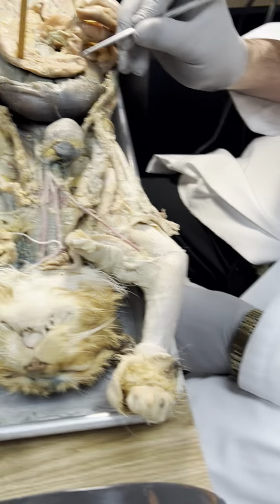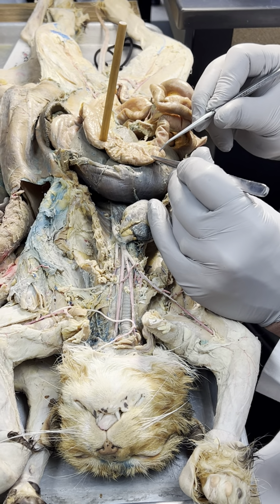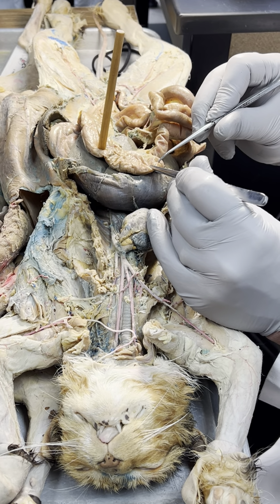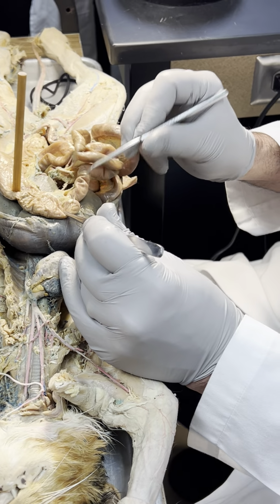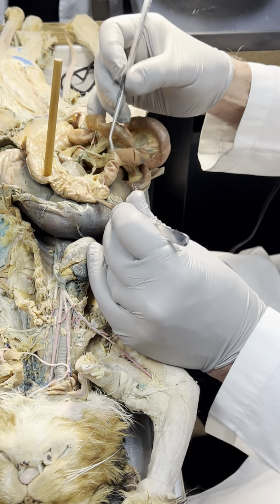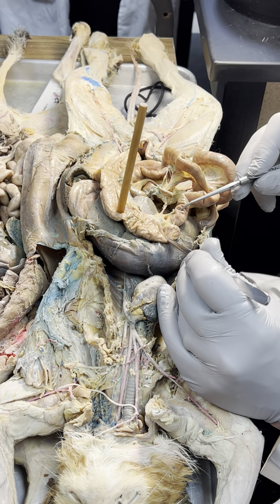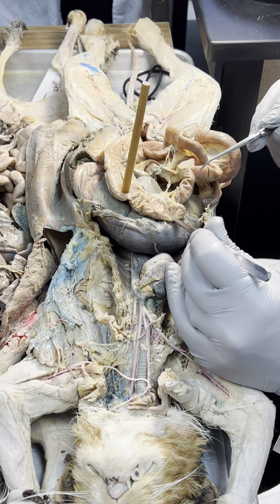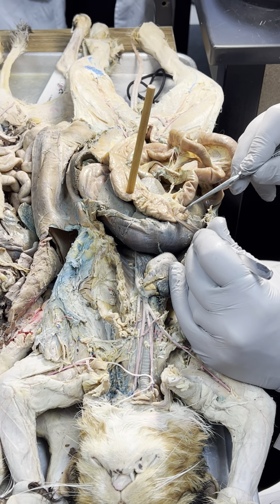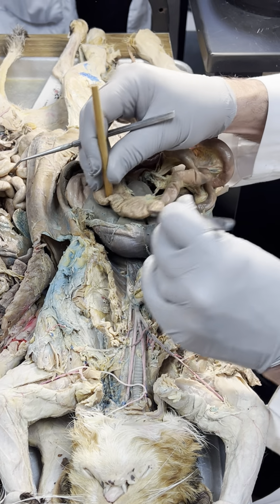What's that? Cecum. Excellent. Cecum. What's that? Ileum. This is the small intestines going into the colon and the cecum, so that's ileum. Here's another hint for you. Every test, I either do ileum or cecum. One of them is on there. You're going to see it exactly like this.